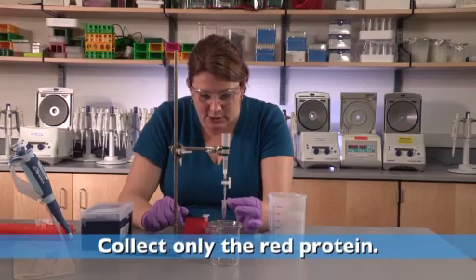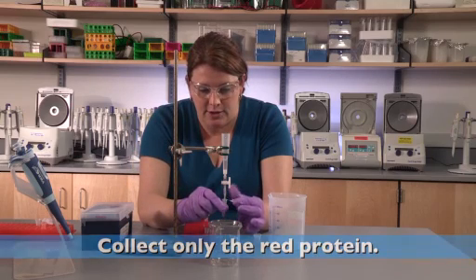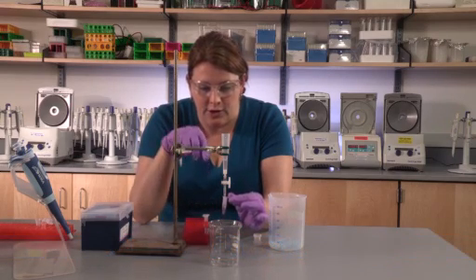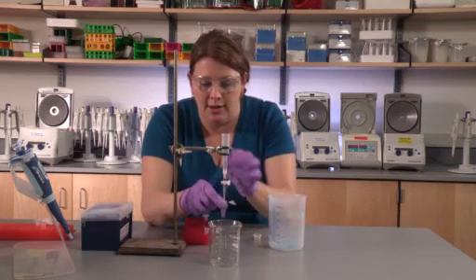Once the solution becomes clear again, you'll know that you've collected all of your red fluorescent protein. Close the stopcock and close the tube.